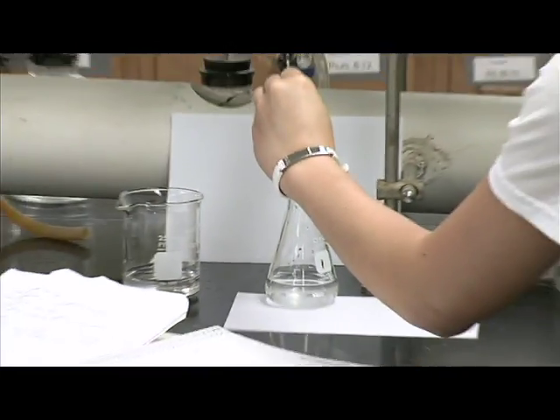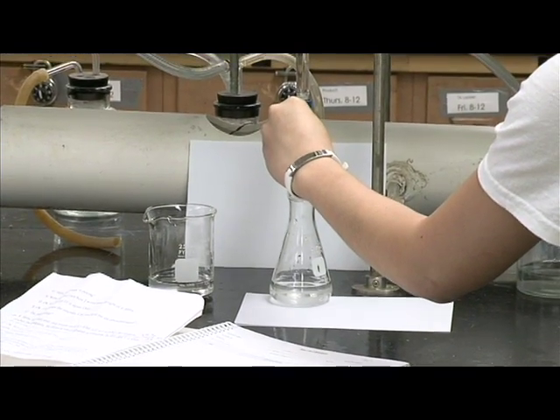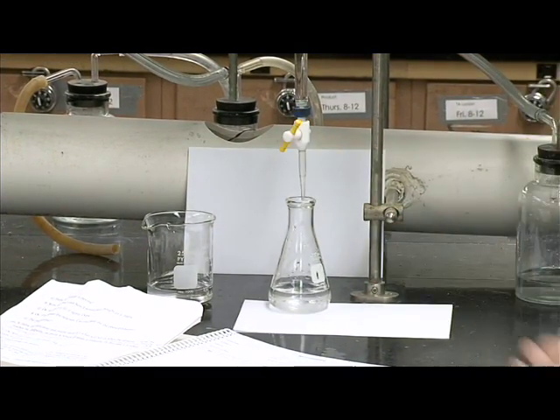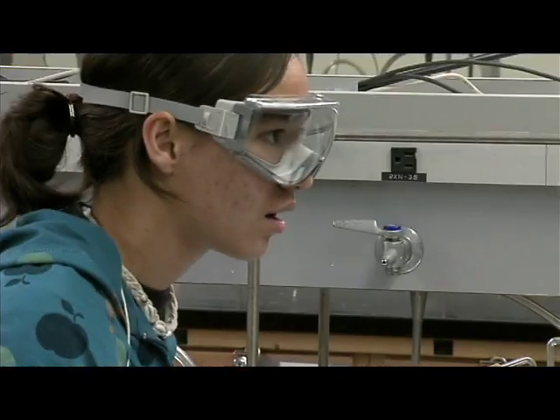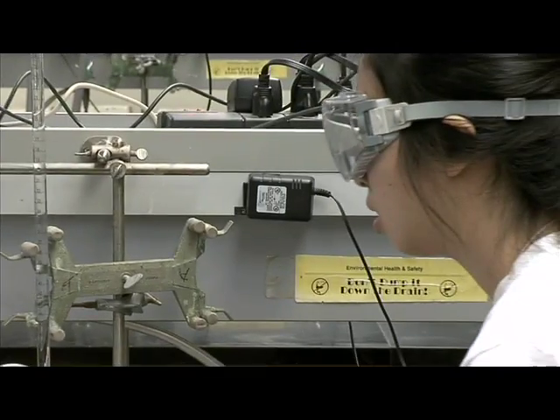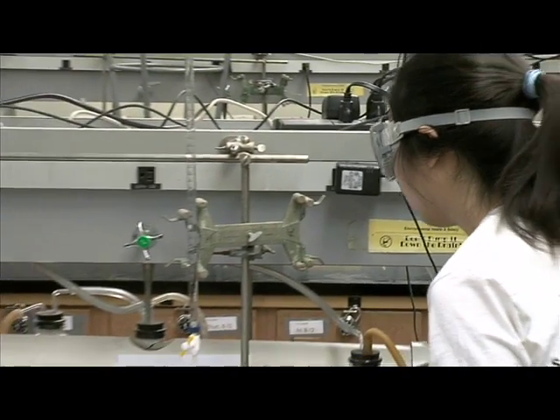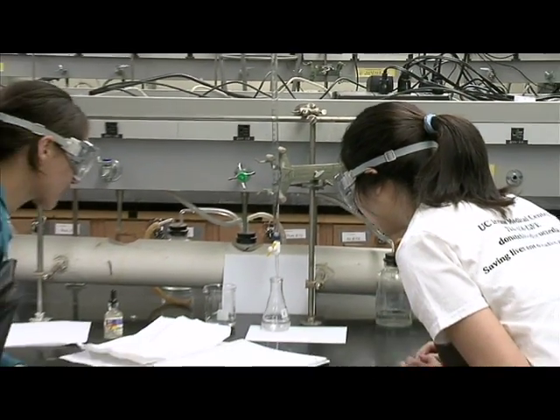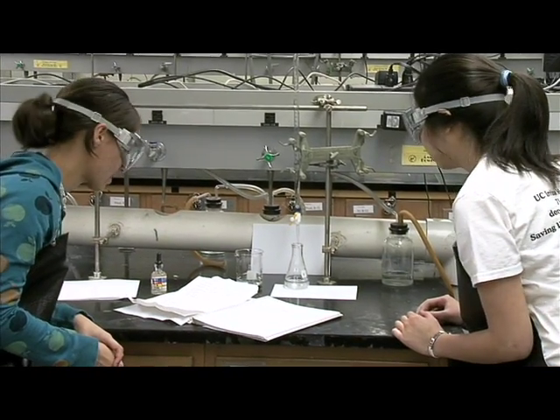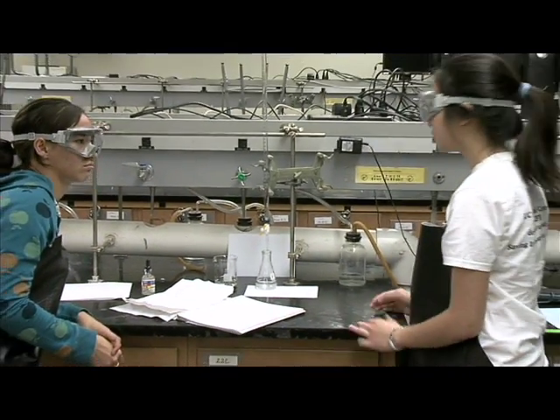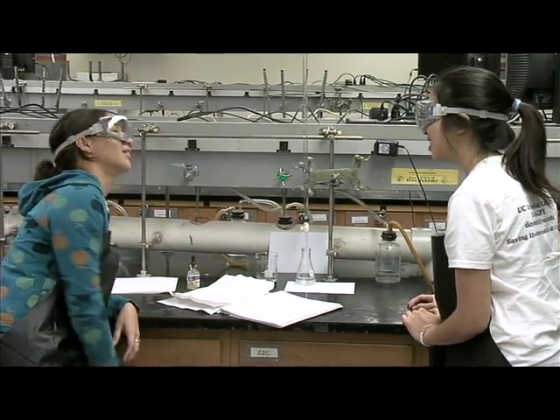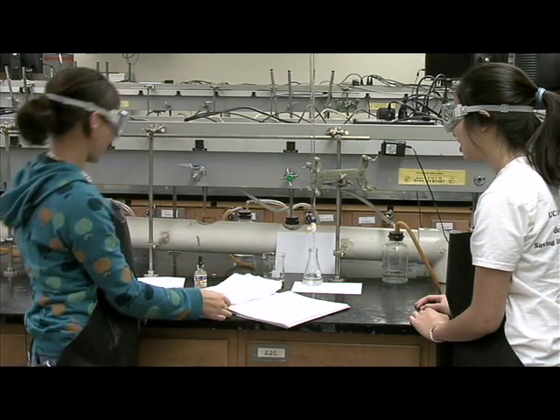It's taking longer for it to turn back to clear again. It can take only a single drop to turn the entire thing pink. Wow! I know. It's crazy, huh? Yeah. Focus, Grace. Concentration is key right now. Well, obviously. We're trying to find the concentration. You crack me up.